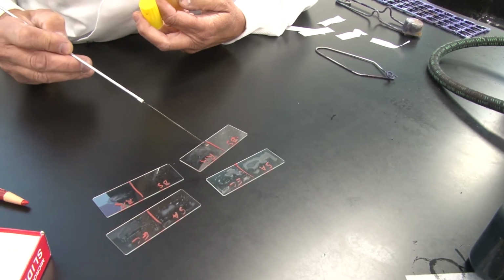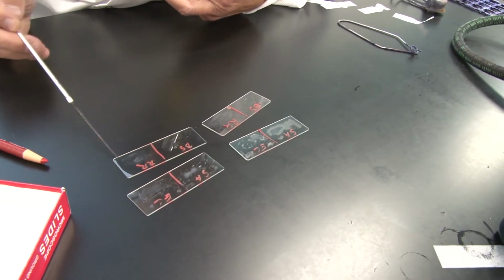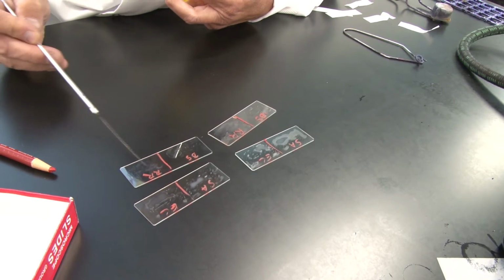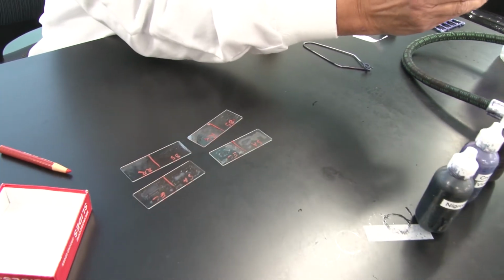It looks as though I have a chunk of agar there, and that's something you want to avoid when you make bacterial smears. You don't want to bring agar onto the slide. It's hard enough to find the bacterial cells when you're looking at spicules of agar and trying to decide if that's what you should be focusing on. It can be a little bit frustrating.